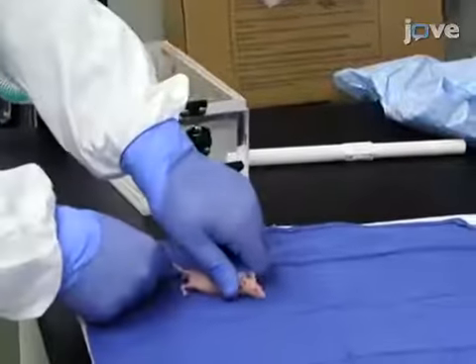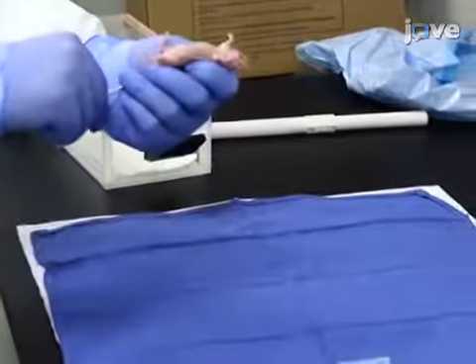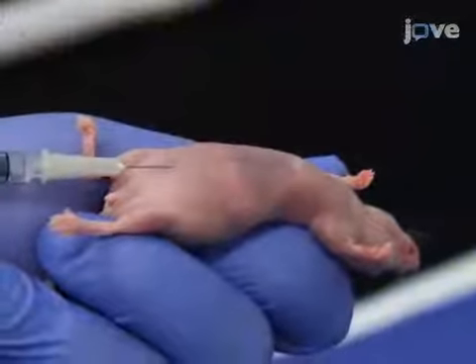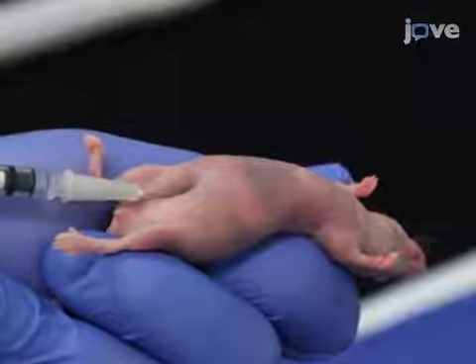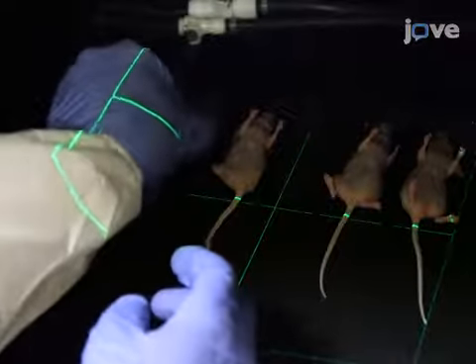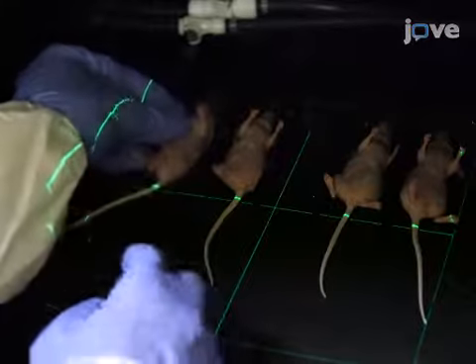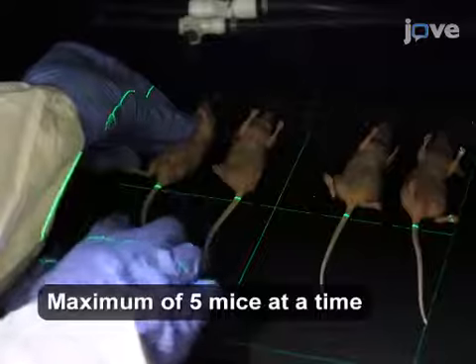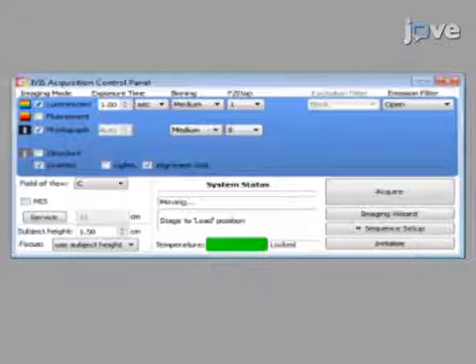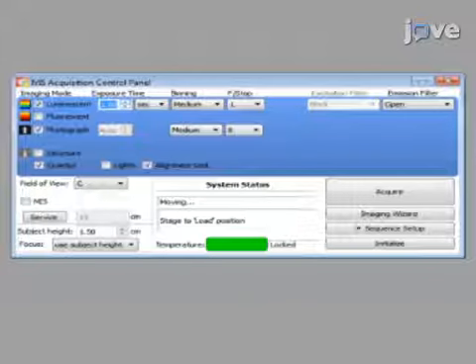To perform bioluminescent imaging, after anesthetizing mice according to the text protocol, intraperitoneally inject the animals with 150 microliters of previously prepared firefly luciferin. Place the mice in an IVIS in a supine position with spacers in between the animals to minimize the signal to adjacent mice.